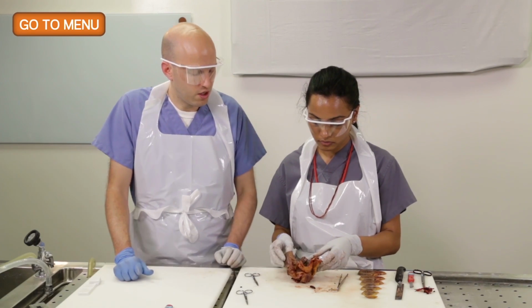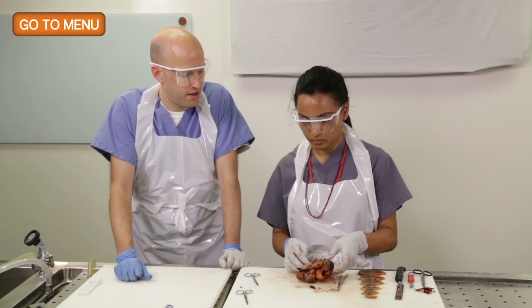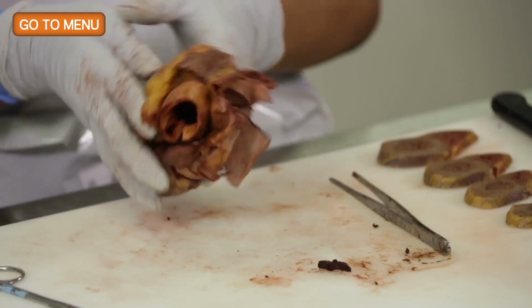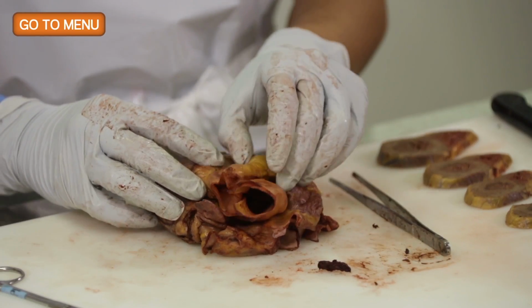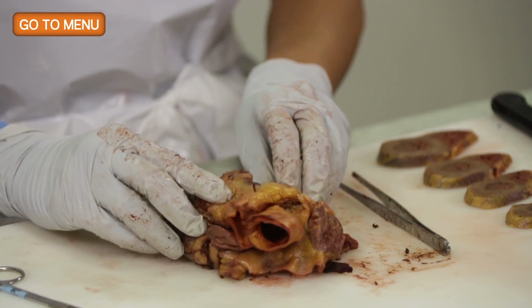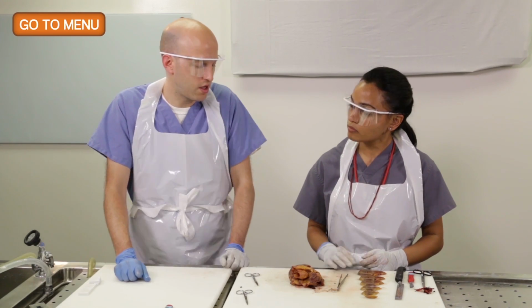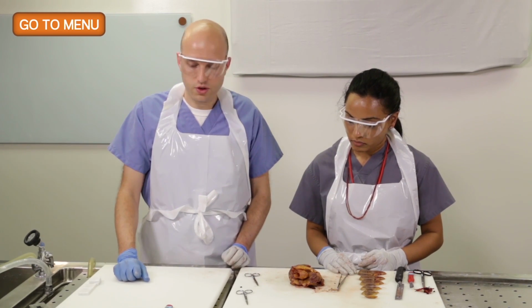So now we need to do a couple more measurements, and then we'll take our sections. We want to measure the left ventricle thickness as well as the right ventricular thickness, and the place we want to do that is 1 centimeter below the atrioventricular valves.